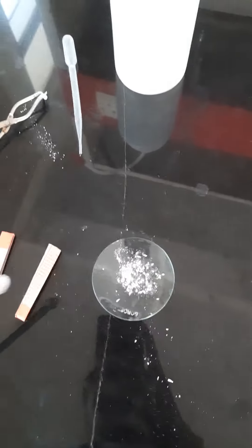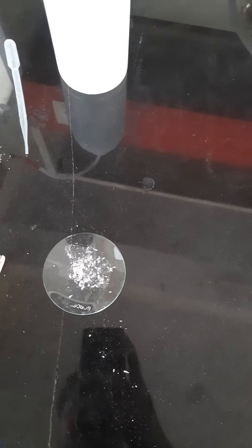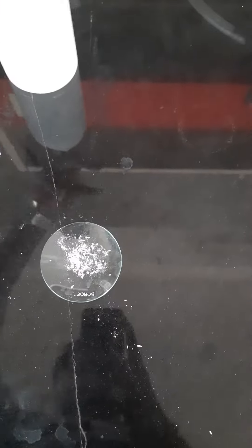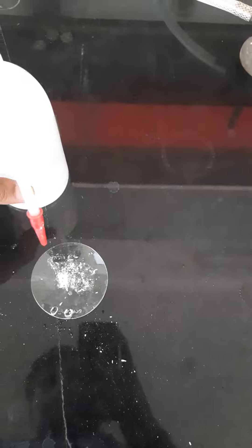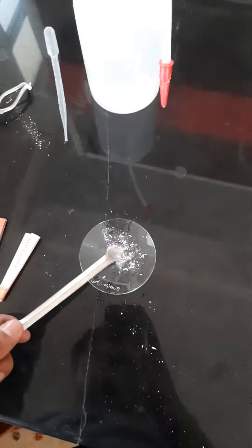Now let's check whether it is basic or acidic in nature. I have two litmus papers — red litmus paper and blue litmus paper. Let's see. First, we will add a drop of water and make a liquid solution, and then check whether it is acidic or basic in nature.